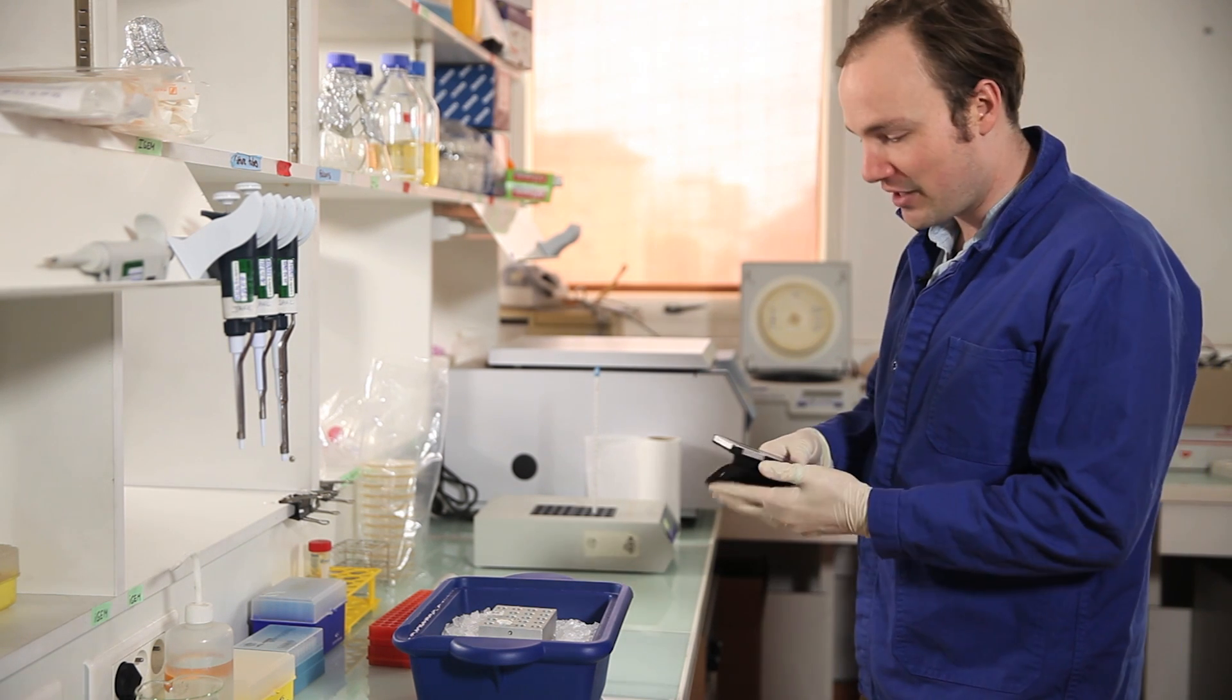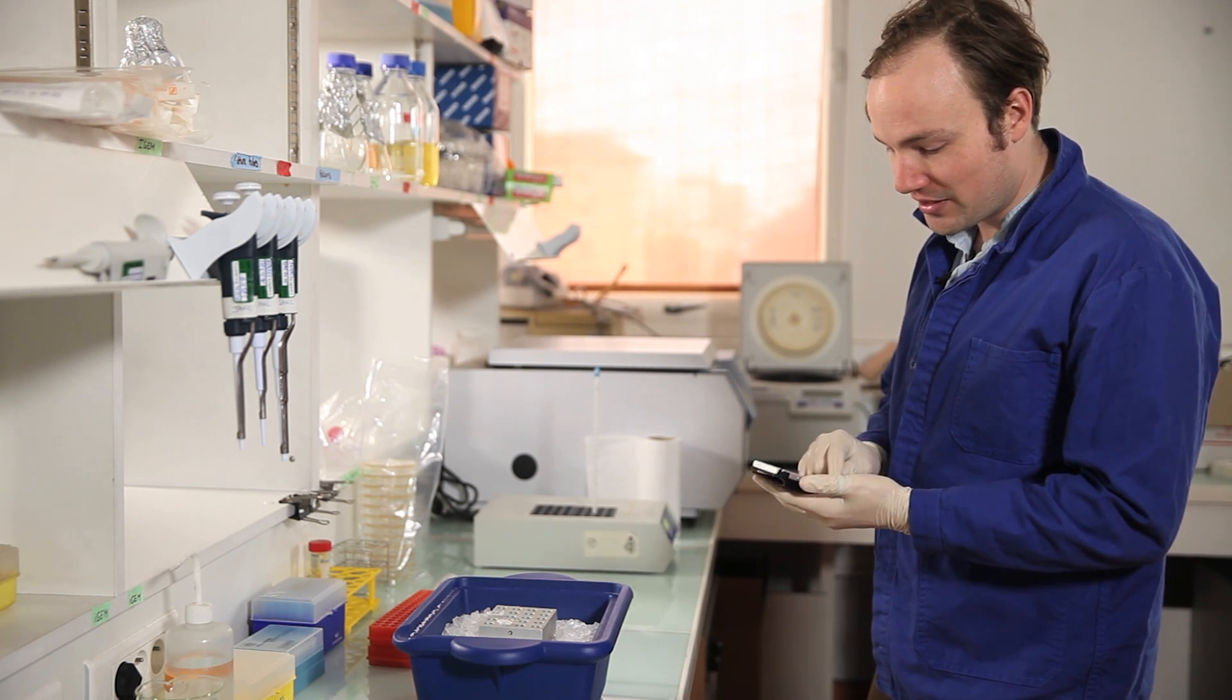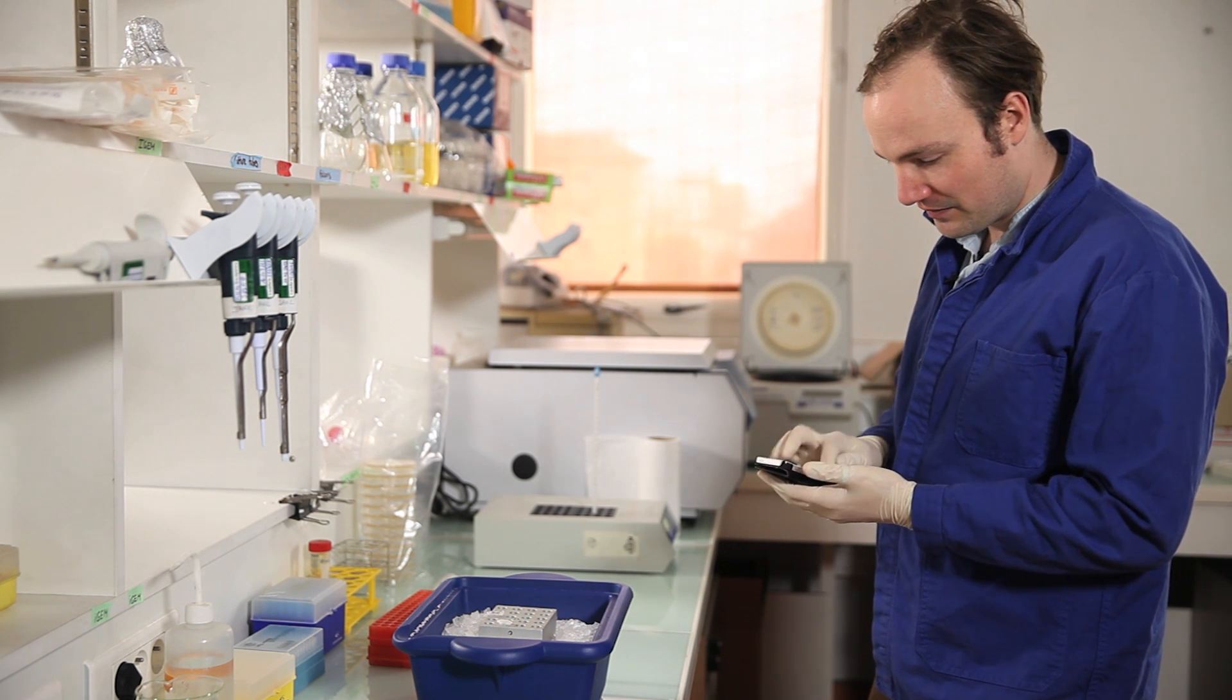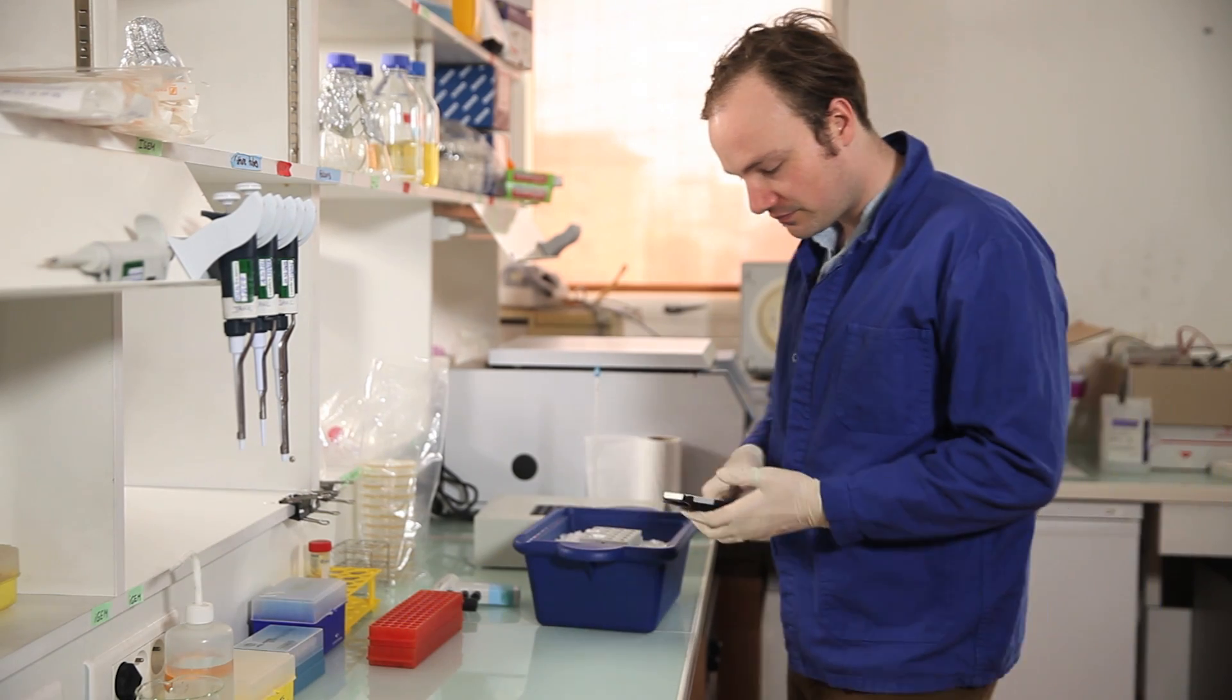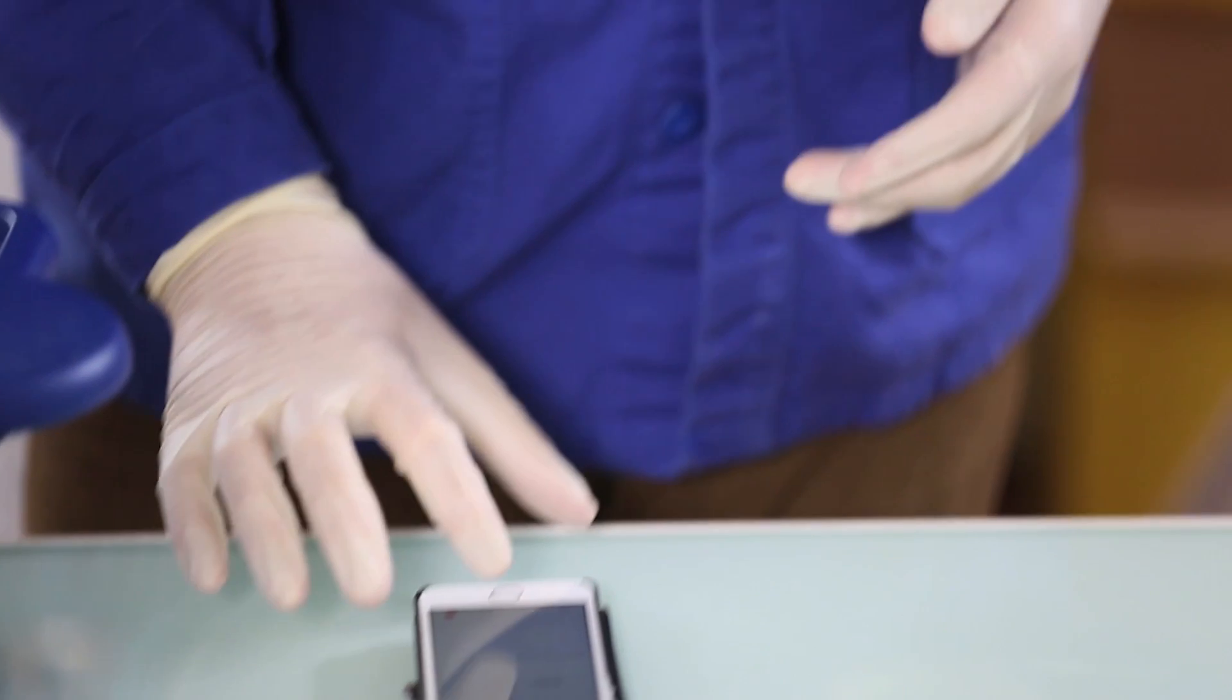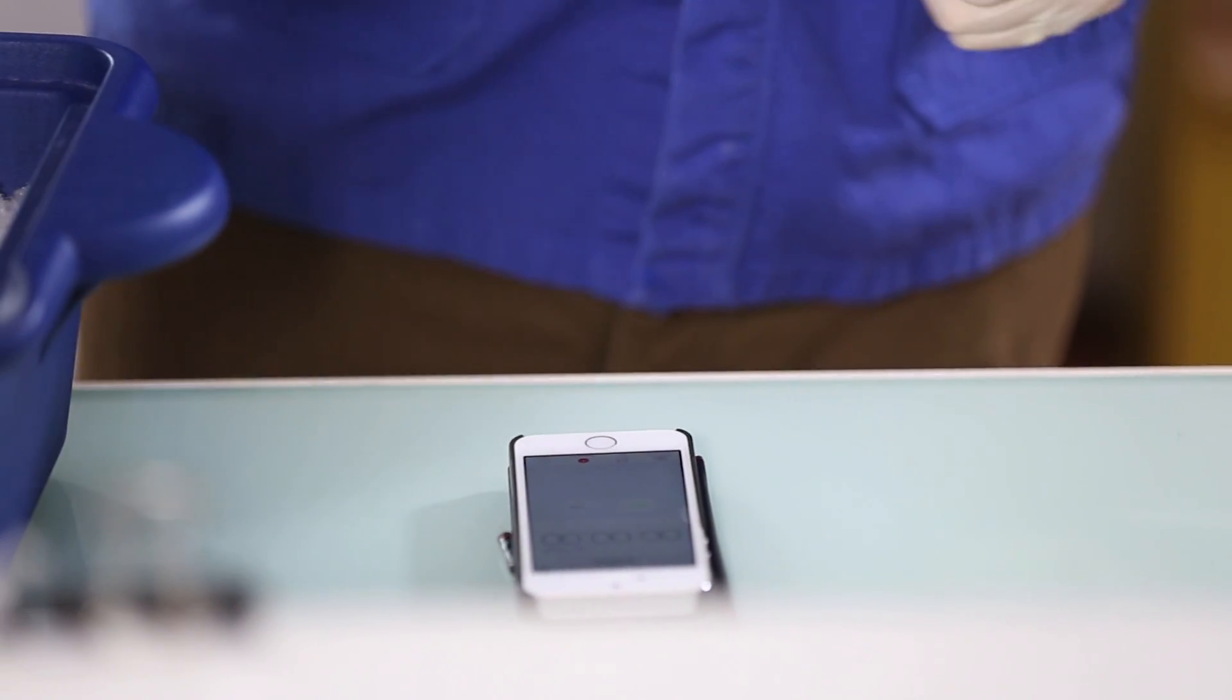So I don't have a timer handy around here, so I'm just going to time it on my iPhone.